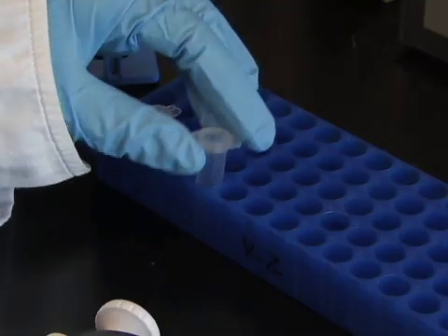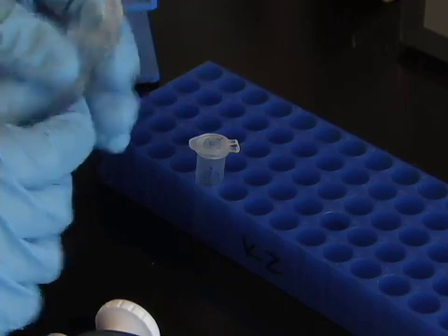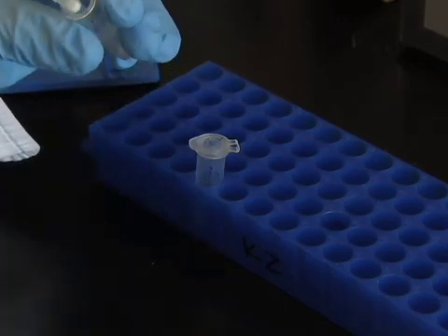After the 20 second sonication, add the 50 microliters DNA water solution to the gold.